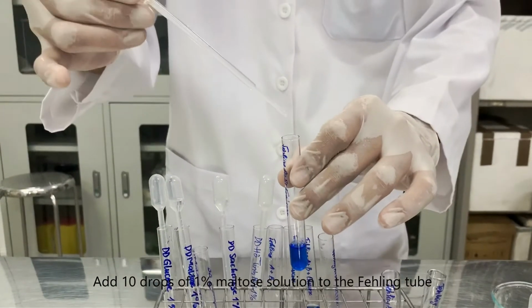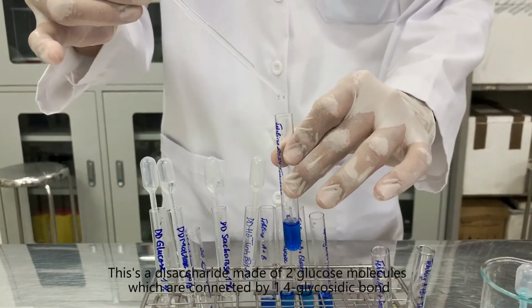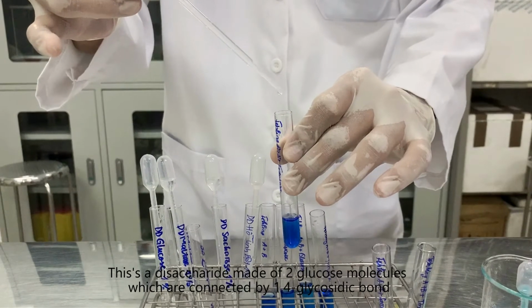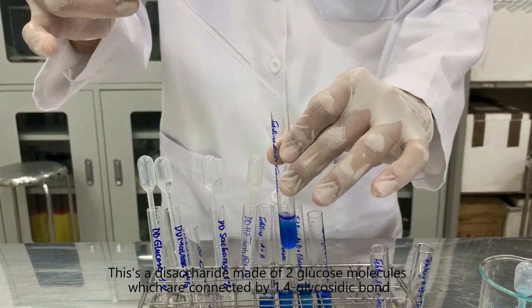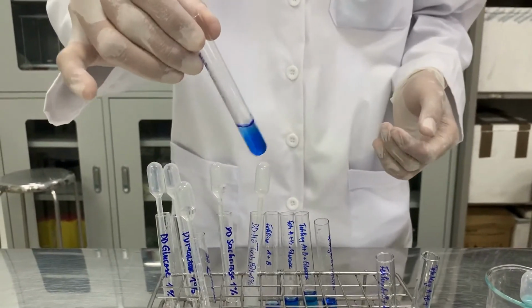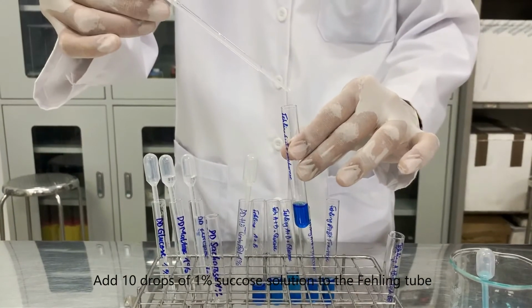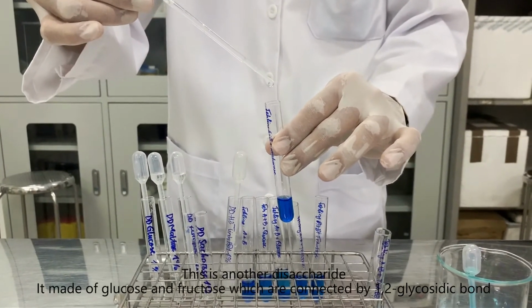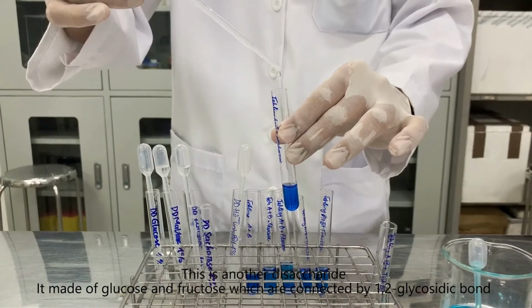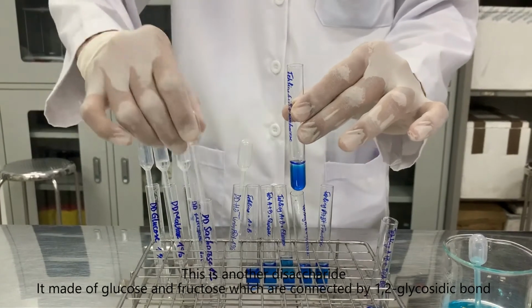Add 10 drops of 1% maltose solution to the Fehling tube. This is a disaccharide made of 2 glucose molecules which are connected by one α-1,4-glycosidic bond. Add 10 drops of 1% sucrose solution to the Fehling tube. This is another disaccharide. It is made up of glucose and fructose which are connected by one α-1,2-glycosidic bond.